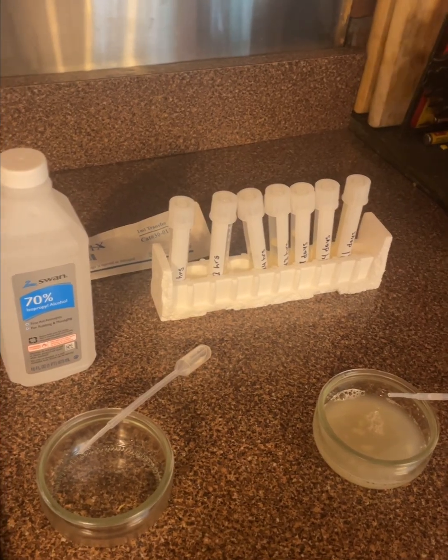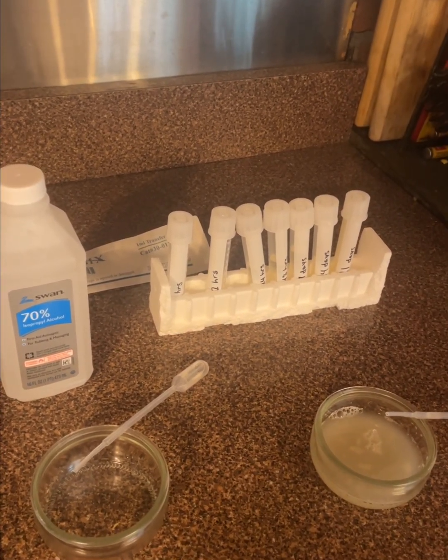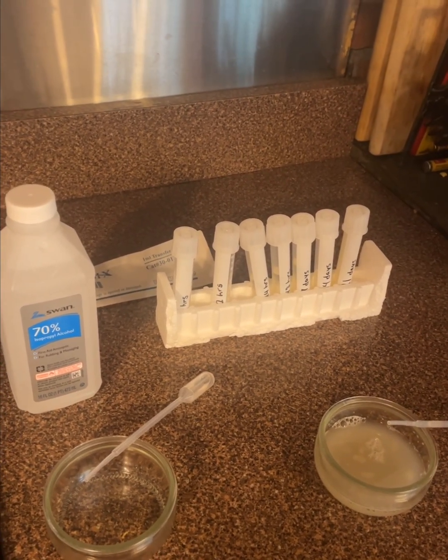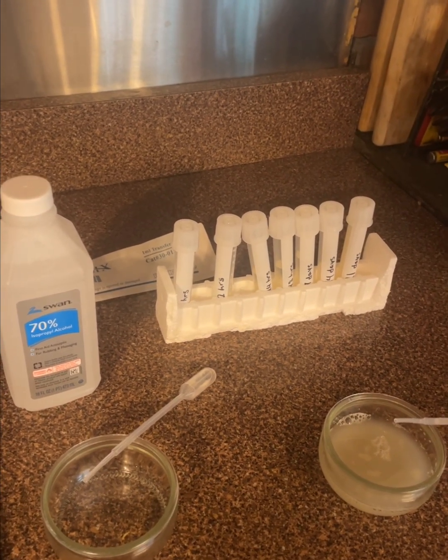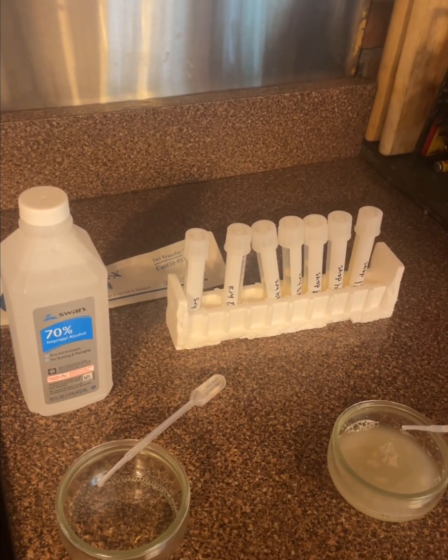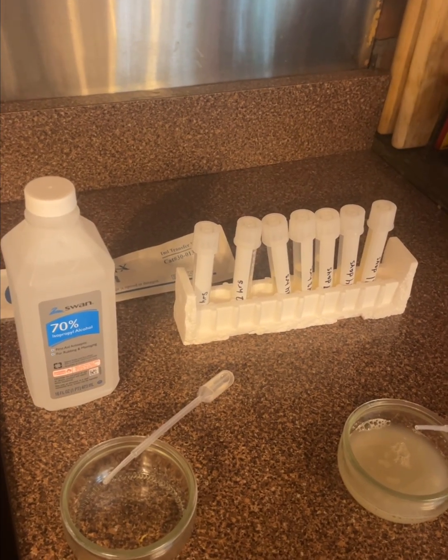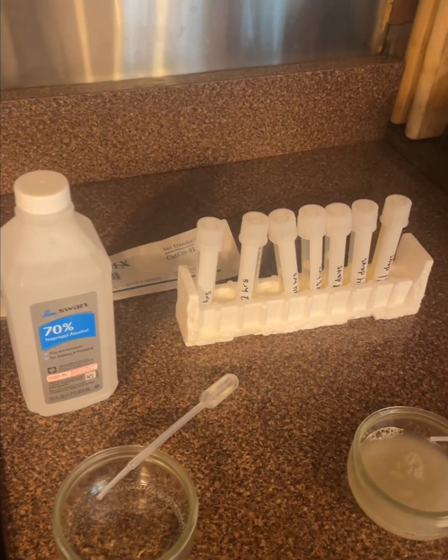microbial growth. My hypothesis is that both the physical and chemical treatments will reduce bacterial growth compared to the untreated control. However, I expect the alcohol-treated sample to show the greatest reduction in bacterial growth because alcohol rapidly disrupts cell membranes and denatures proteins. I also expect boiling to significantly reduce microbial growth because moist heat denatures proteins and damages essential cellular structures within microorganisms.